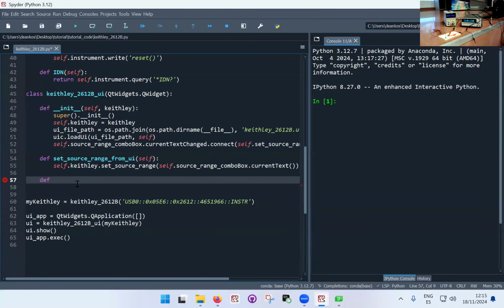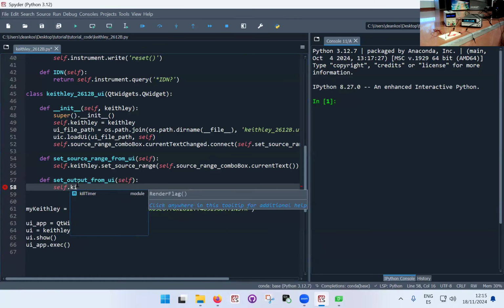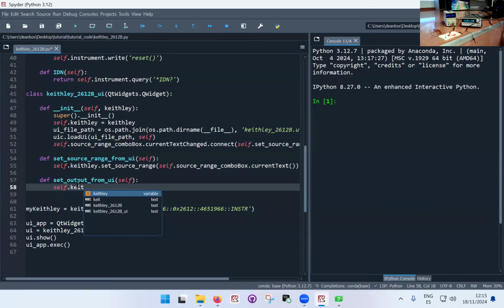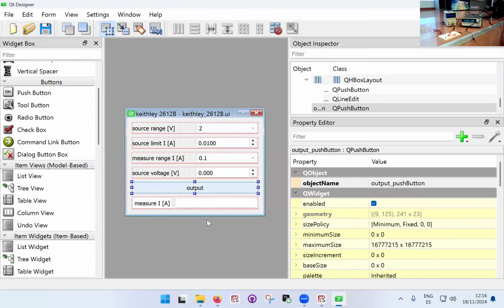So right, here we're going to put another function, set output. Again, I'm going to label it from UI, just to be completely clear. And here, self.keithley. Well, actually, here I'm not passing a value, I'm just telling the Keithley to turn on. Conceptually, I've implemented this as a button, so I don't have to read any value.